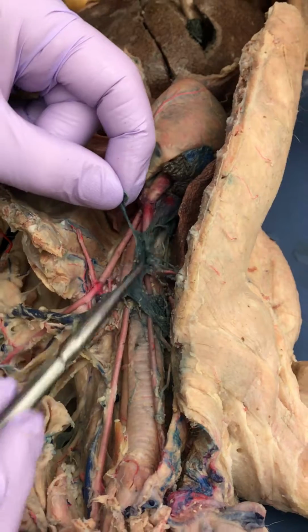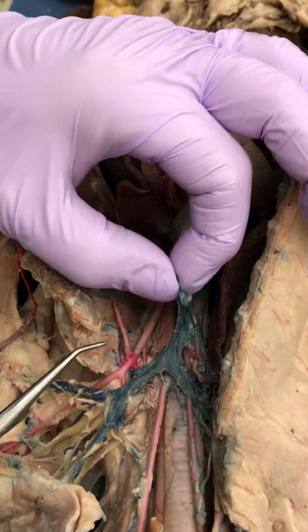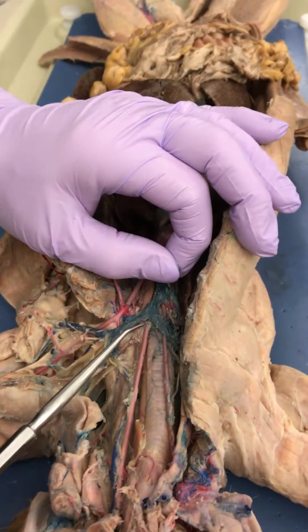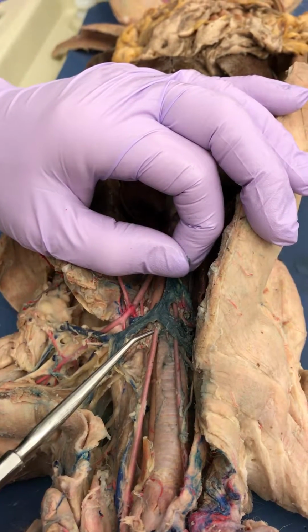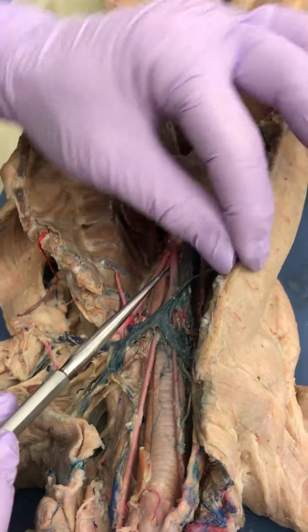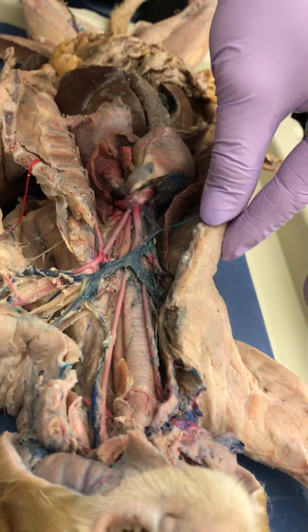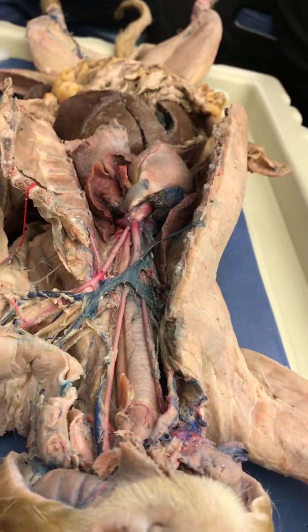There it is. Up there. Hey Chris, is your cat the one with the sternal vein that's still attached to the chest wall? Okay. Yeah. So if you look at Chris's cat and Paulina's cat, their sternal vein will still be attached right there. Okay, cool. But when we open it up, it broke. That's okay.